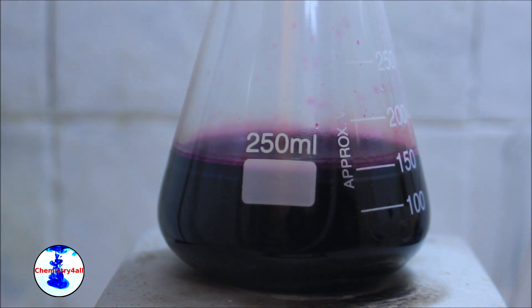You can clearly see how the system starts to reflux after a while. The system is left under reflux for an overall time of 3 hours.